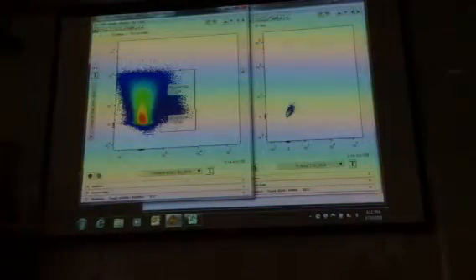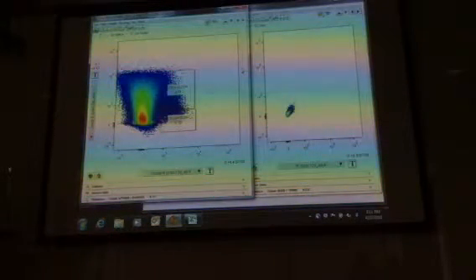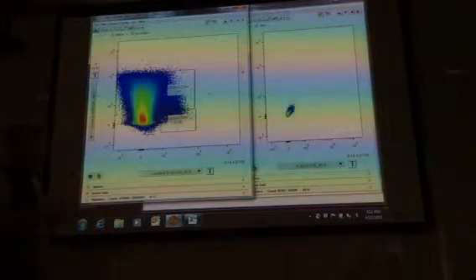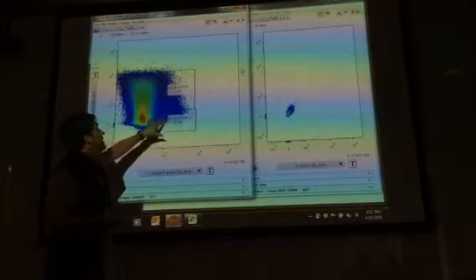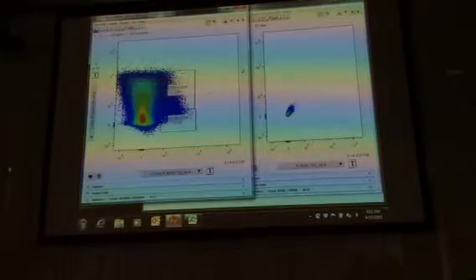This is why flow cytometry is very much subjective to the person who's doing the analysis of it and the differences between it. So what you have to do, and this is again, I went on and on about this, is you have to be consistent with what it is that you're doing. You have to be able to convince yourself where you're actually going to put these gates. Because in this situation, there's no clear cutoff. Now, what else could we do?